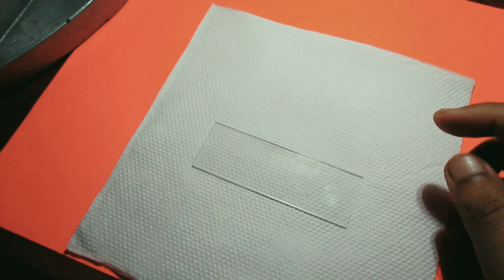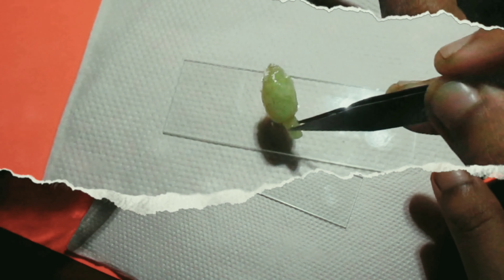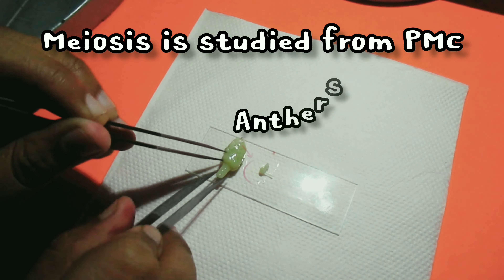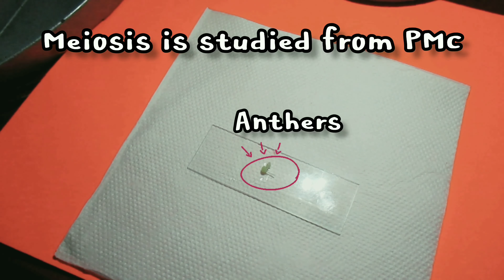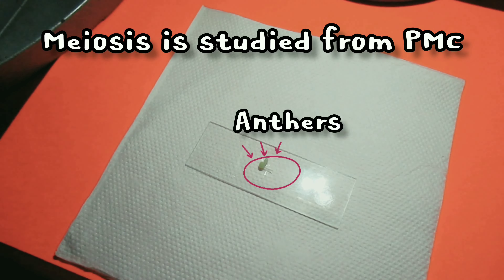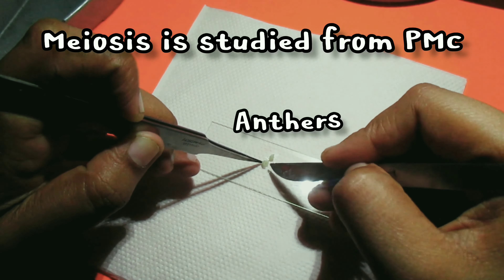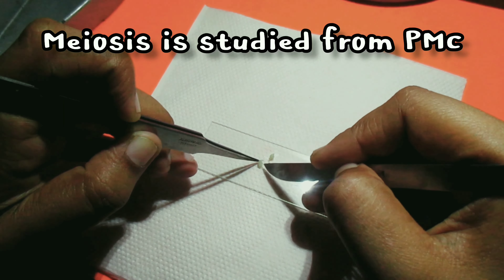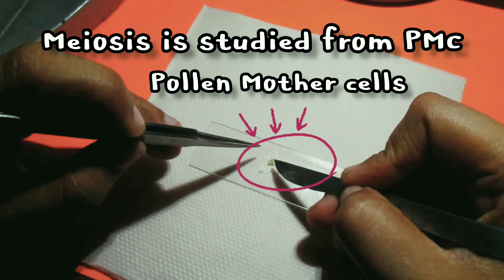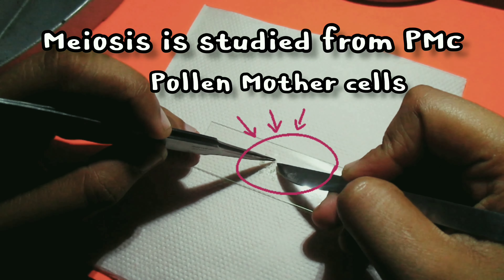In higher plants, meiosis occurs in pollen mother cells present in the anthers, and also in the megaspore mother cell within the ovule. An ovule contains only one megaspore mother cell surrounded by several layers of vegetative cells, making it rather difficult to work with. Anthers, on the other hand, contain large numbers of pollen mother cells which can be easily exposed by bursting the anthers, so usually meiosis is studied from pollen mother cells.